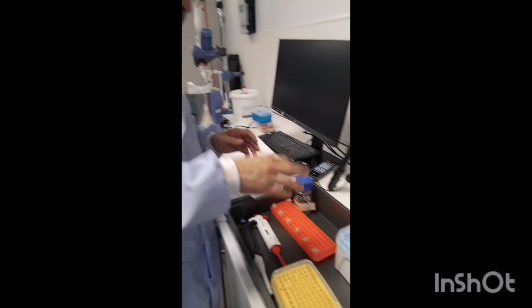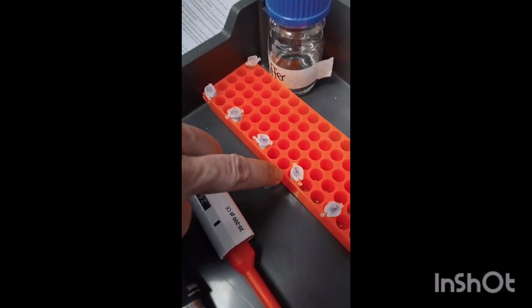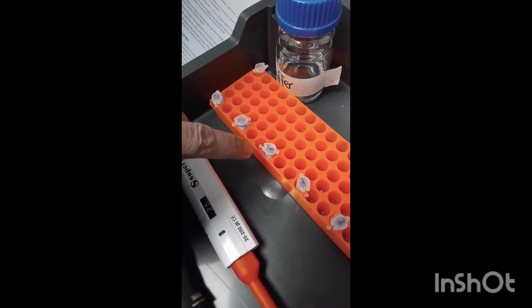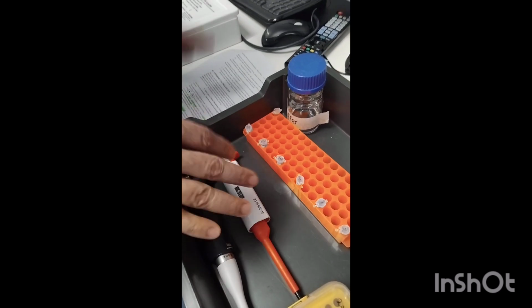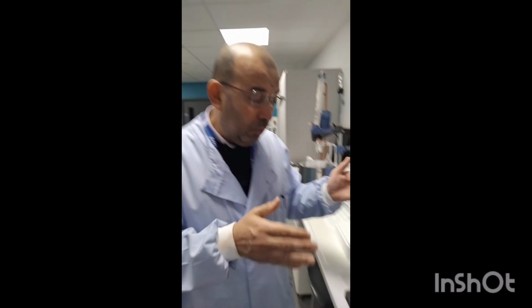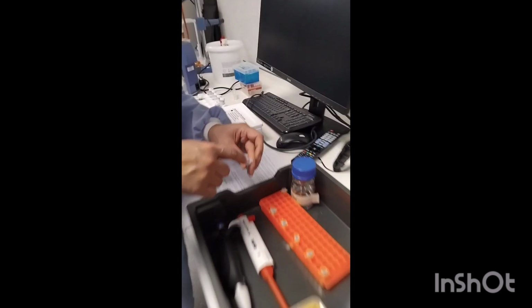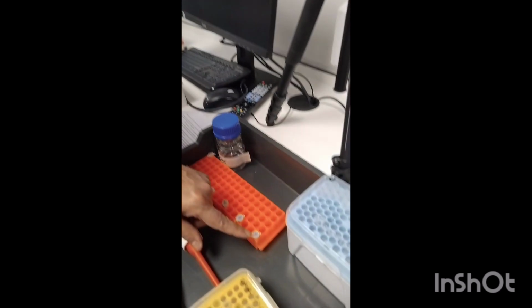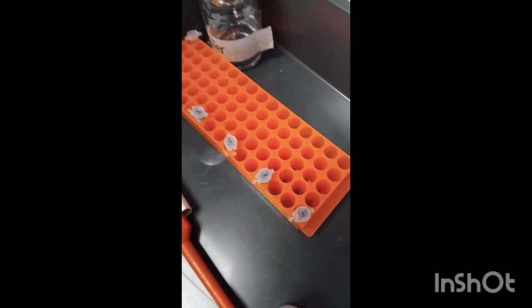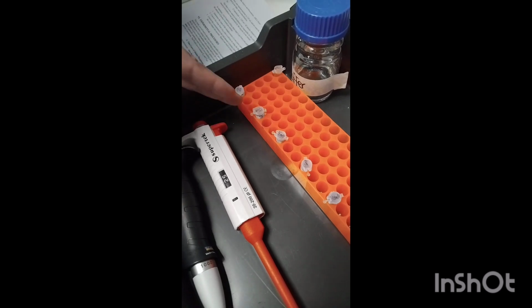Okay, then repeat the experiment with 10 millimolar going up, then with 25 millimolar, then with 50 millimolar, then with 75 millimolar. Already we did the 100 millimolar. So what we are doing in section 2, we are repeating the same set of experiments but with different substrate concentrations. In section A, we start with the highest concentration, which is 100 millimolar. But now we'll change the substrate starting with 5 millimolar, finishing it, go to the 10, after finishing it to the 25, then go to the 50, 75.